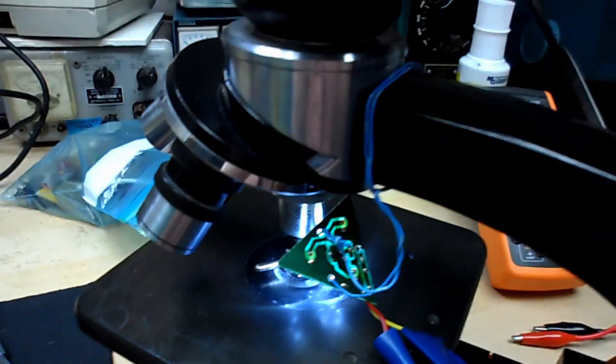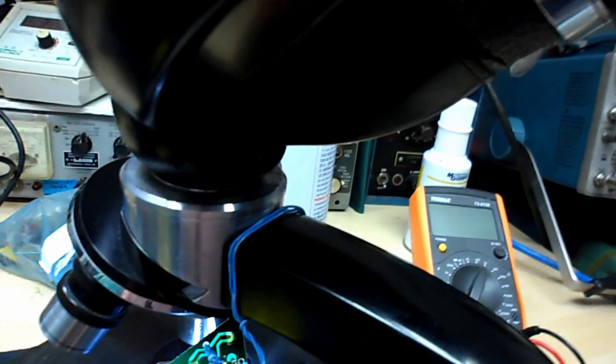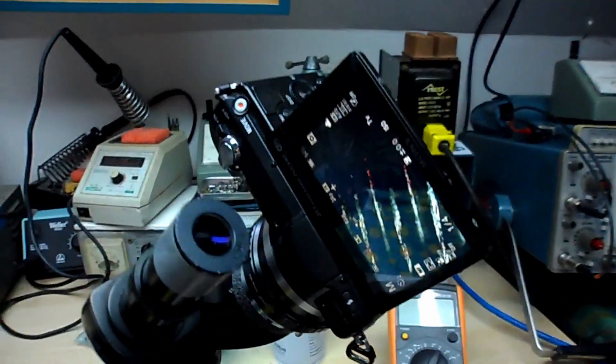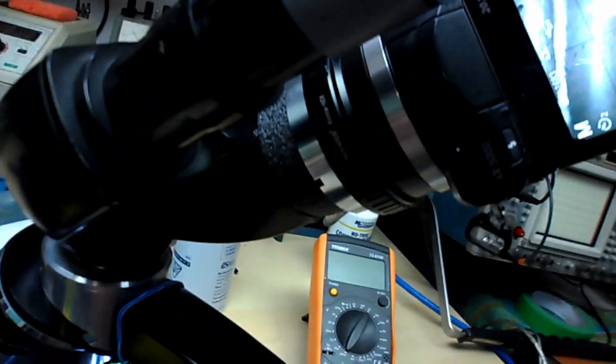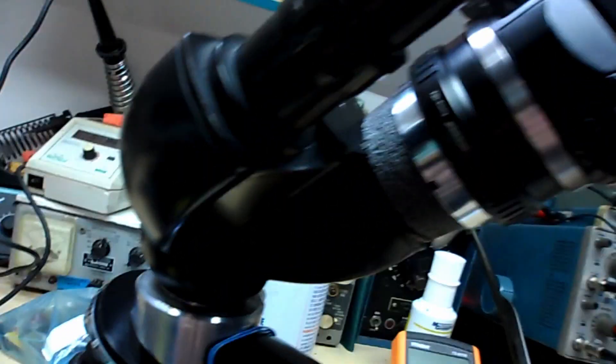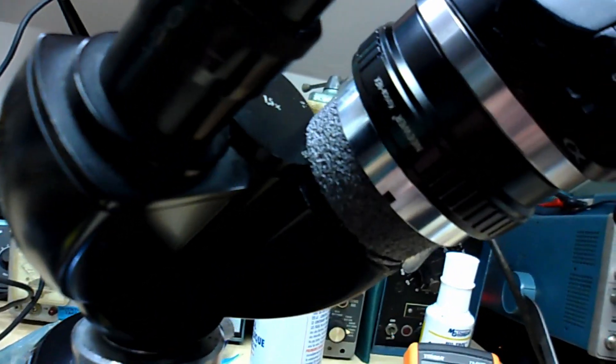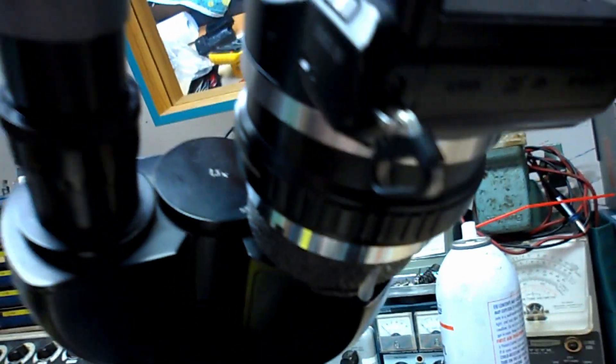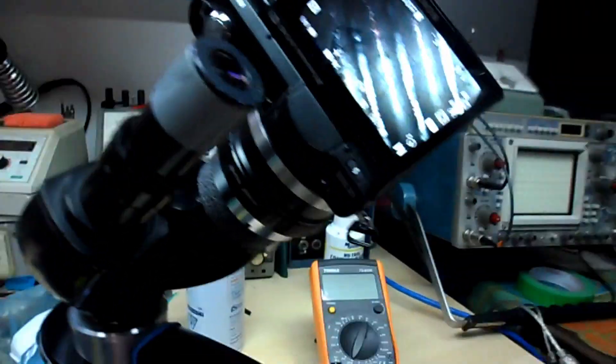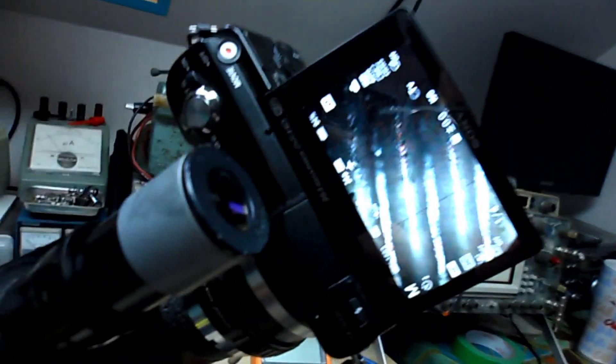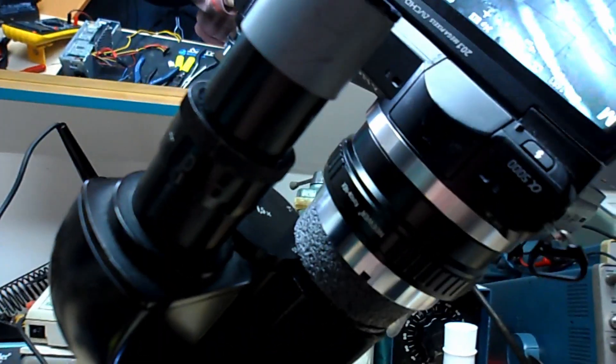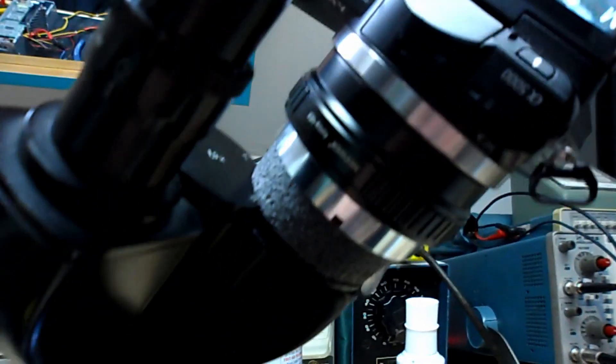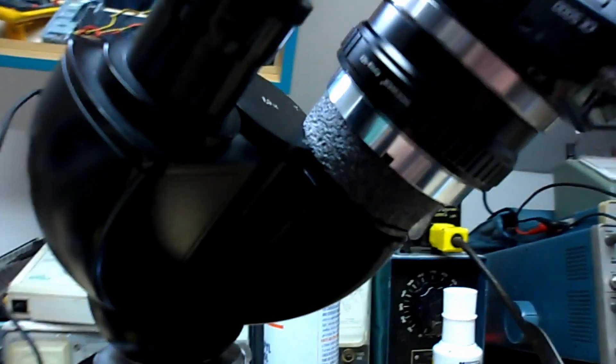The real challenge actually turns out to be mounting a camera to the thing. So this is what I have been sort of figuring out and I think I've come to a decent compromise here, a solution. It's not ideal maybe but it seems to work.